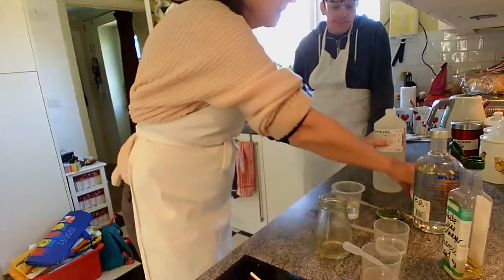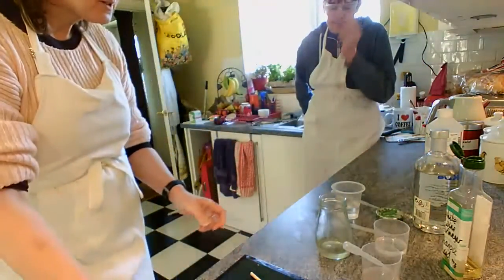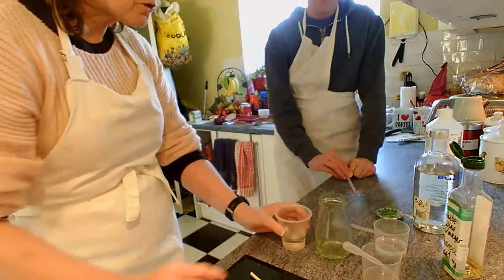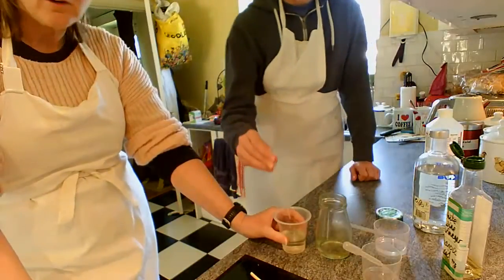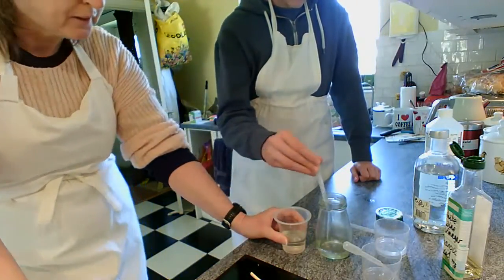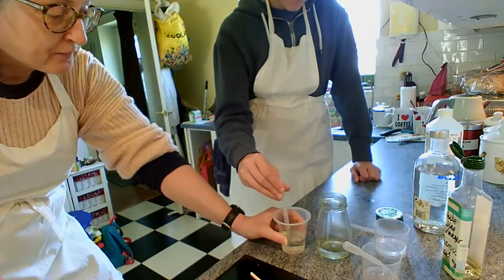Okay, we shouldn't need too much of it. It is our catalyst, and it's supposed to be fairly strong. This is stronger than bench concentration, so I'm going to hold the pot so it doesn't do anything stupid to you and try and jump off the table and burn holes in people's socks or anything like that. And arms. Yeah.